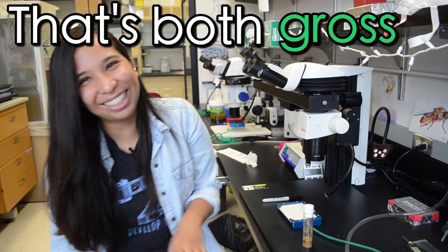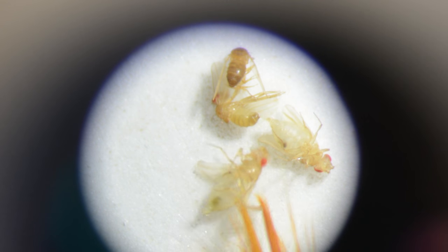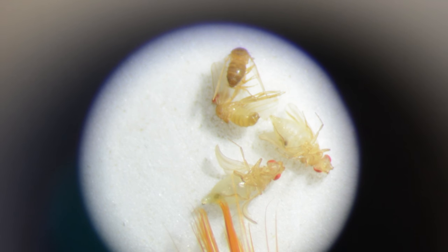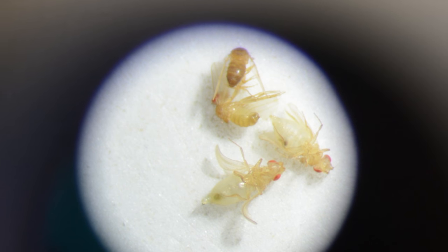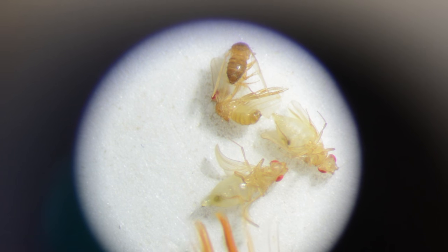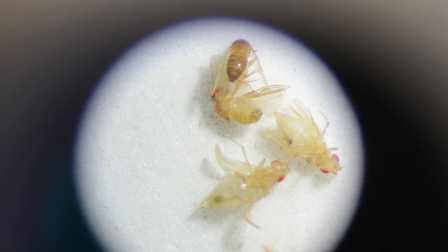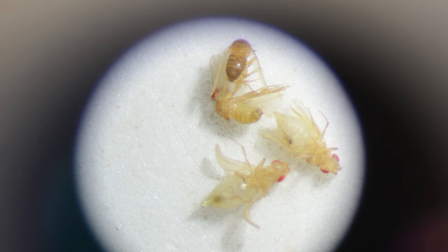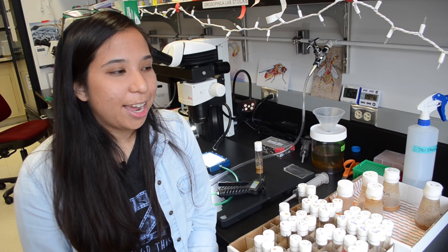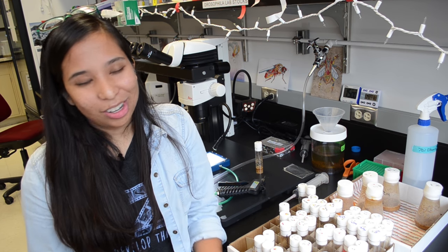You can actually see that right here — this is a really young female fly, and this grayish-greenish spot is actually the gut that she is going to poop out. A fun fact I love to share about guts in general is that by this time next week, our human guts will be lined almost entirely with brand new cells.